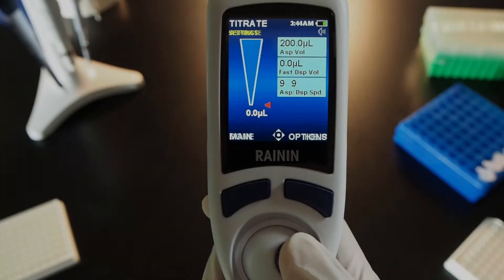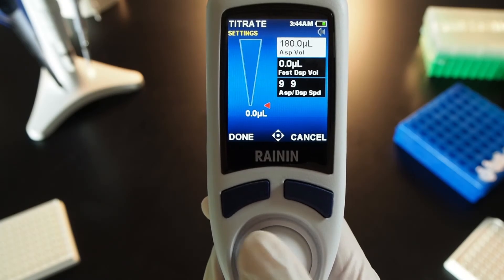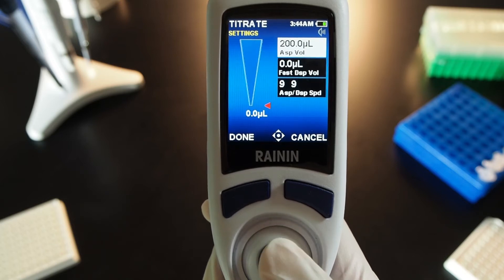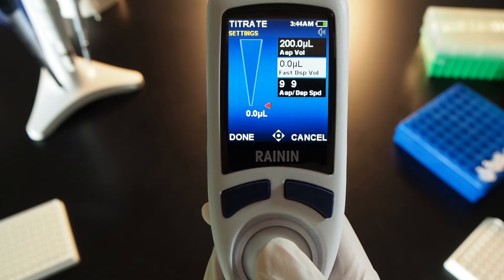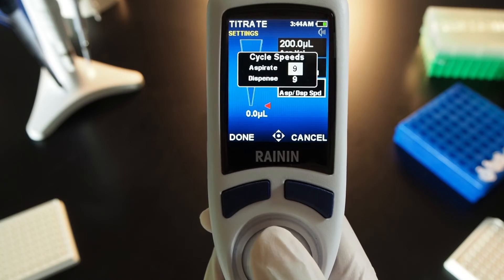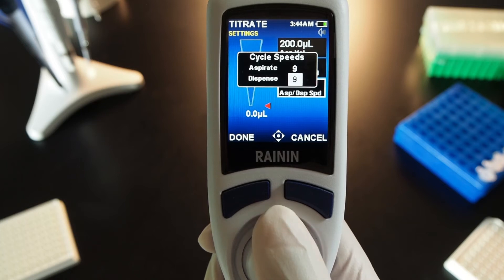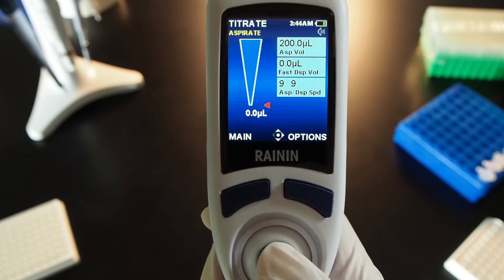Manual titration: joystick right to volume and press the joystick to select it. On this size pipette, left or right changes the volume by 10 microliters; up or down changes it by 2 tenths. Press the joystick in to set the volume. Leave the fast dispense volume at 0 for now. Press the joystick to select speeds and press it again to choose and adjust aspirate or dispense. Left and right adjust by 5 and up and down change by 1. Press done to set the speed and press done again to exit.